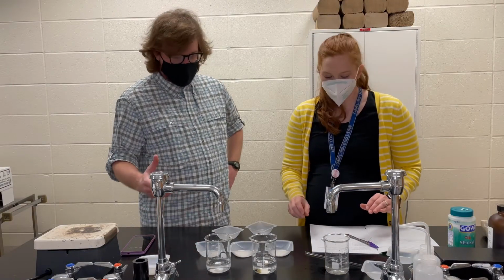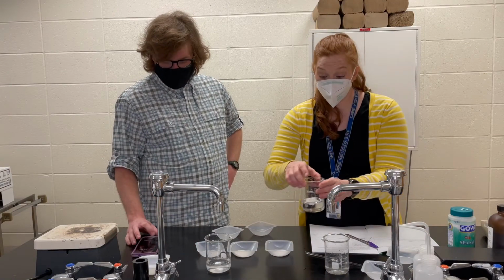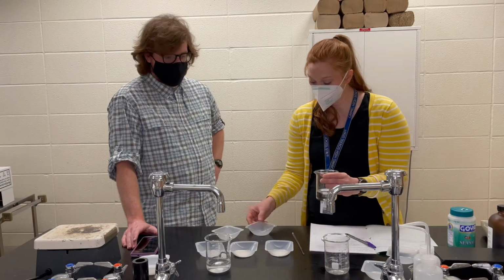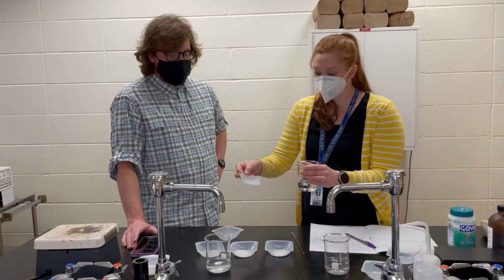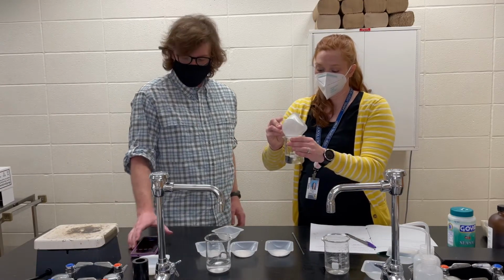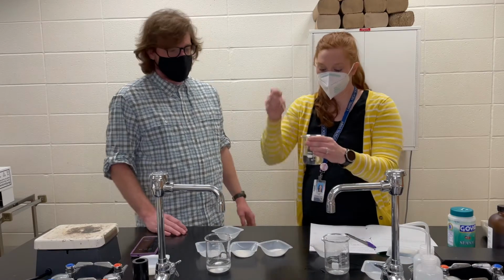All right. Second up. Now I'm going to continue to stir as we're going to keep that variable consistent here. I'm going to try my very best to make sure that I'm stirring in the same manner, same amount of force here. So there's our medium-sized crystals, and here we go. Going.